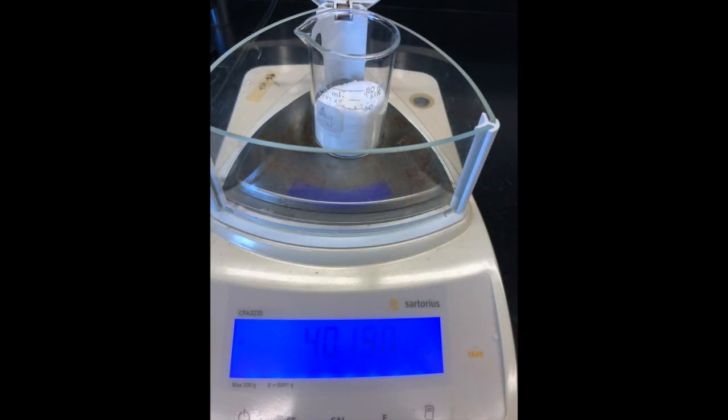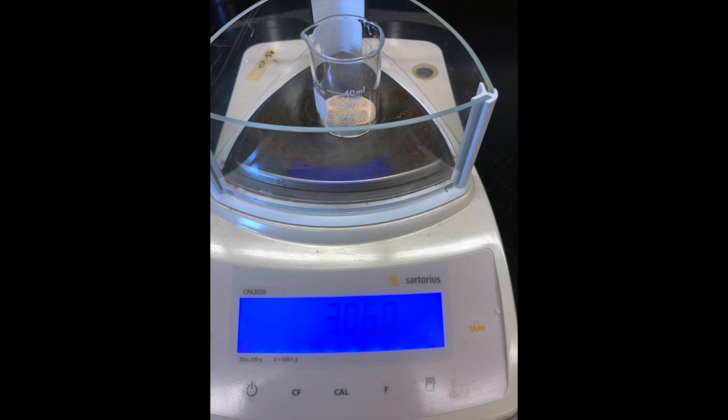We'll start by weighing out the sucrose in a pre-tared beaker. Then we'll weigh the yeast in its own pre-tared beaker.